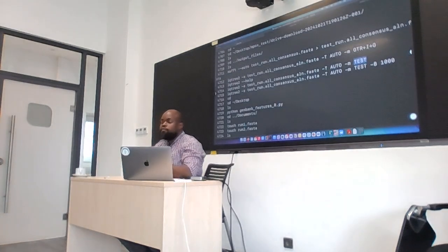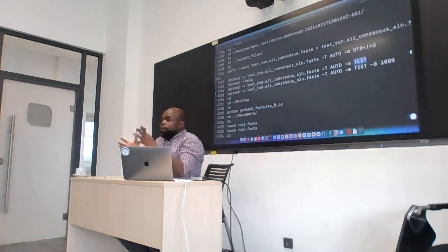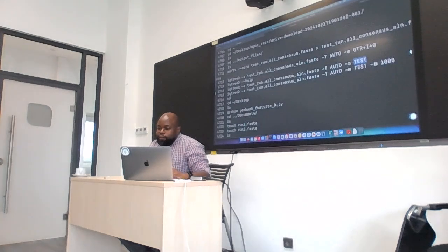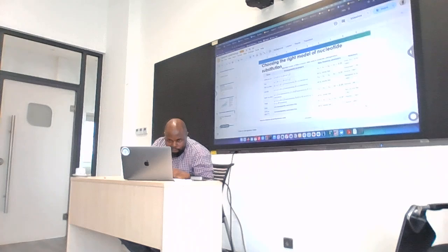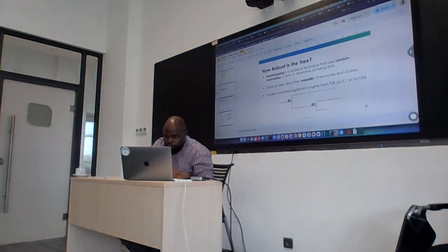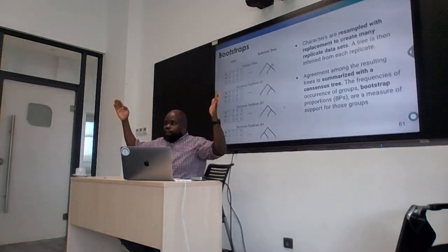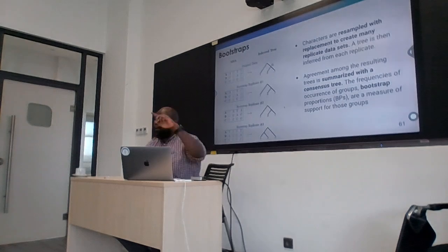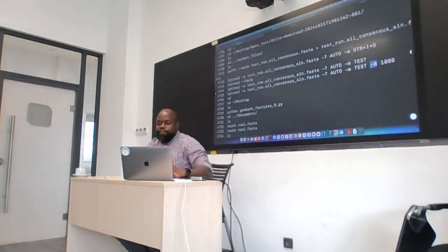Is that good? Now, in addition to the model, yesterday we talked about bootstrap, which is to know how reliable your tree inference is. So in this command, I'm adding the option -B, which says I want you to do 1,000 bootstraps. You remember, I'll just shift back here. We were talking about bootstrapping, where you take a given number of sites and resample, and each time you generate a tree. So on the command line, we're saying we want you to do this 1,000 times. Okay? So the option that I want you to run is this one here.